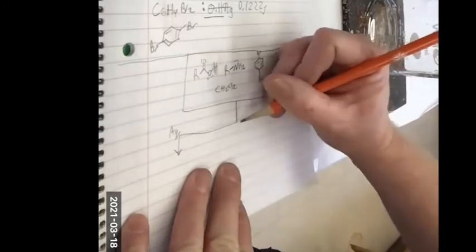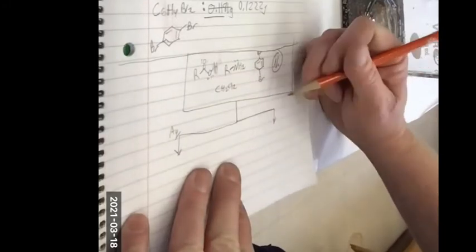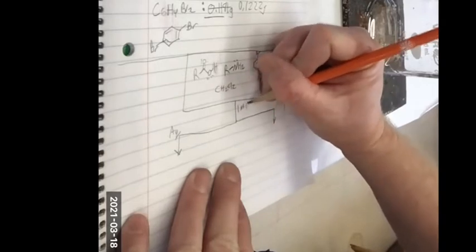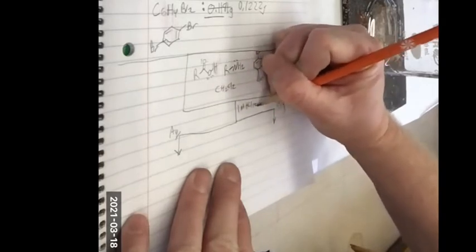So I want to check and see if I have the amine first. What should I add to this to check for the amine? HCl. Yes. I'm going to add 1 molar HCl. 1 molar, not 6 molar, right? Yeah. What's 1 molar HCl mostly? Water. Mostly water.